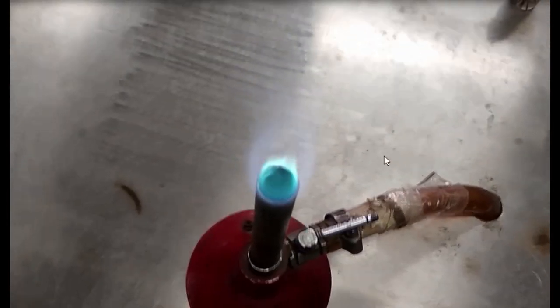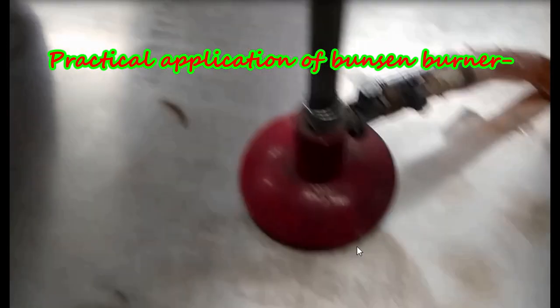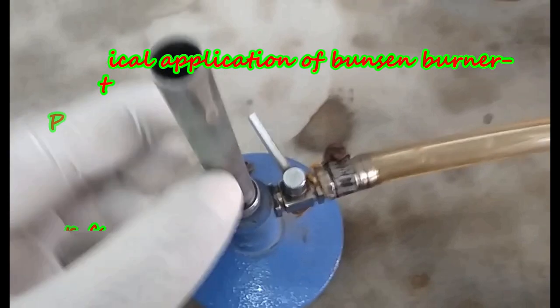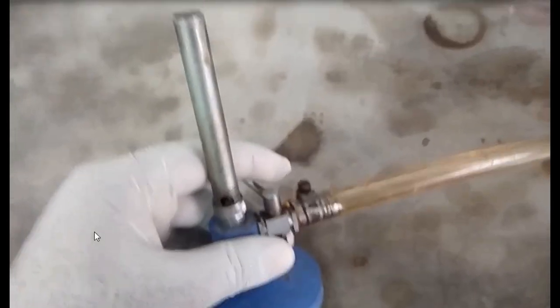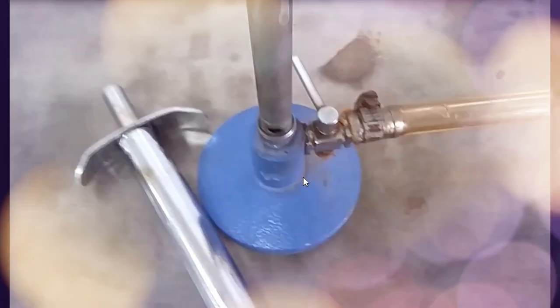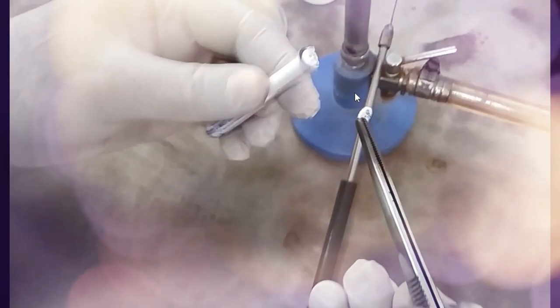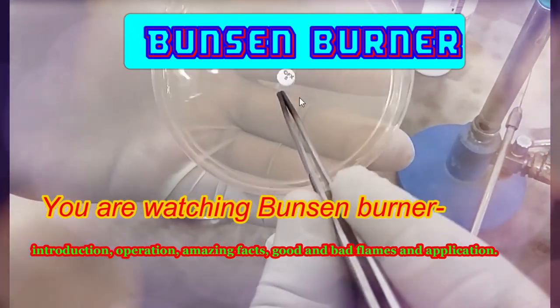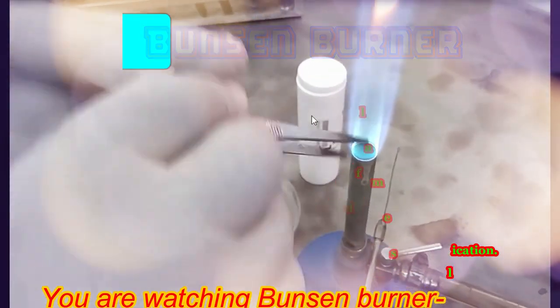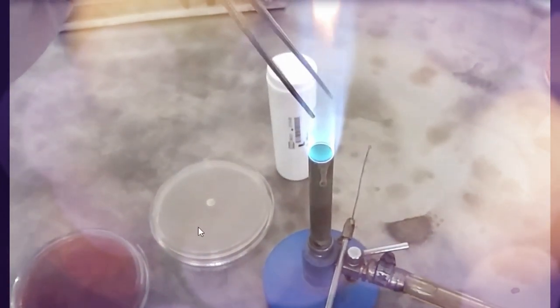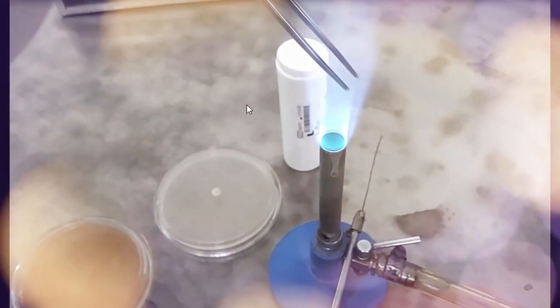Let's know its practical application in the microbiology laboratory. At the time of putting antimicrobial discs on Mueller Hinton agar, if the forceps is contaminated with microorganisms, you can sterilize this forceps in this way.